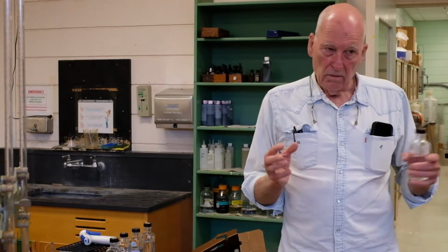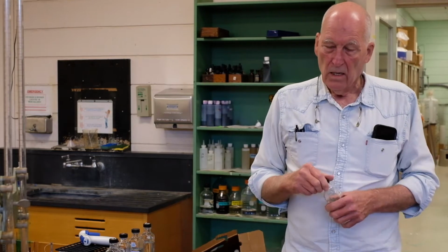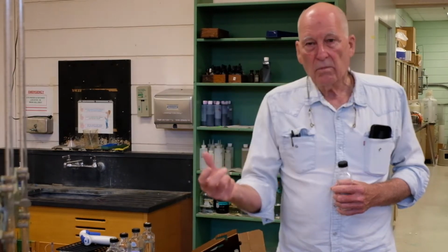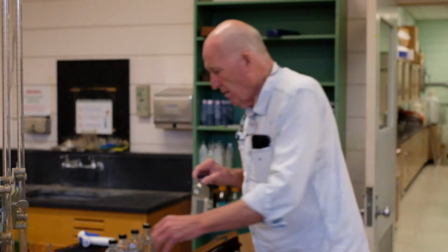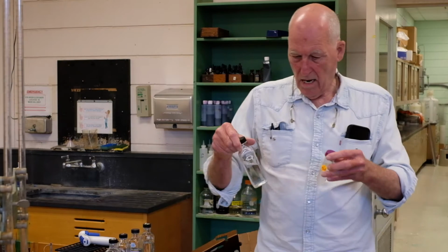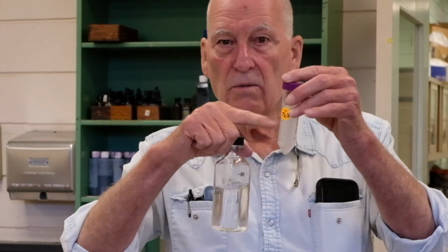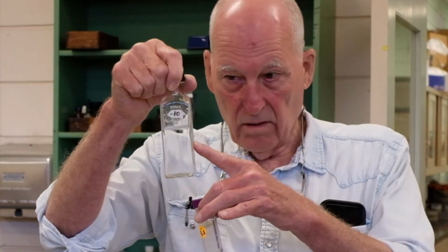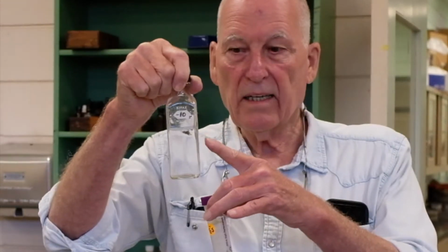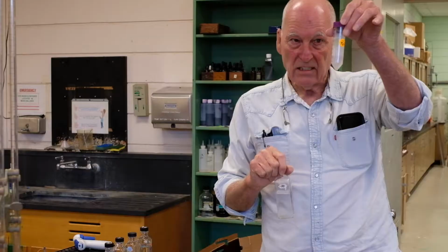I'll remind you that when we did the video of sauerkraut, we salted it down, we drew out the water, and then we took some of the liquid part and we did some enumerations. That was T0, and this is 2 days later. What you see here has microbes, but there's so few that you don't see the turbidity. Here you have a thick, turbid micro mass.